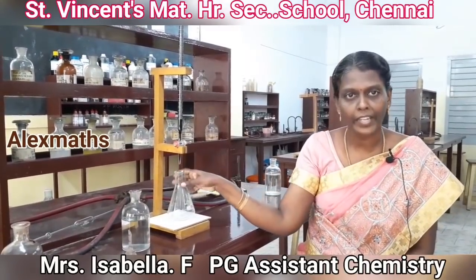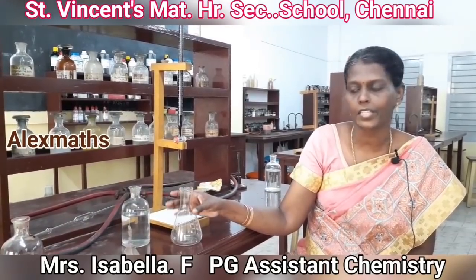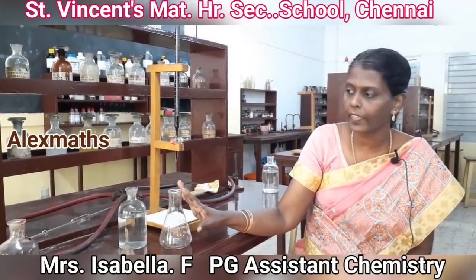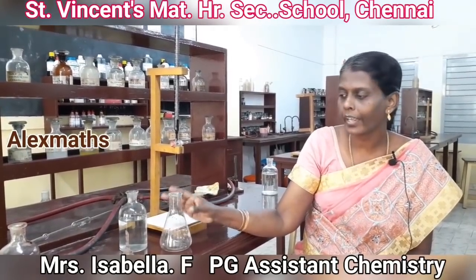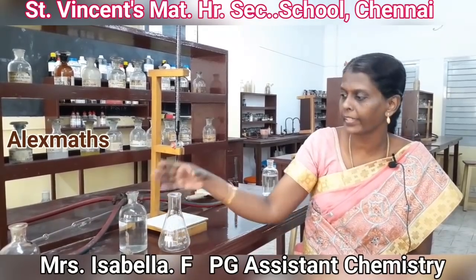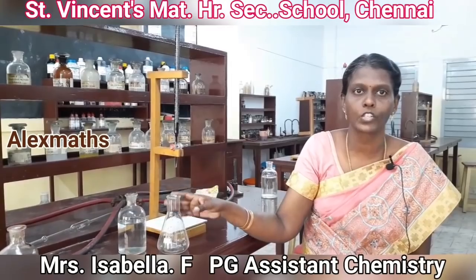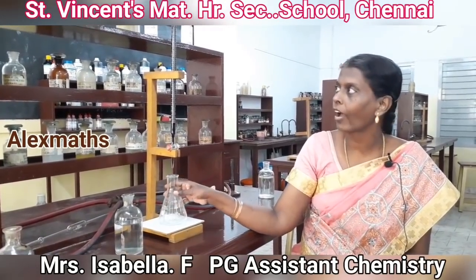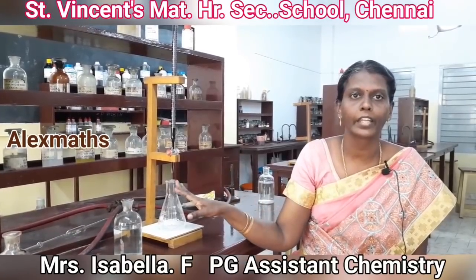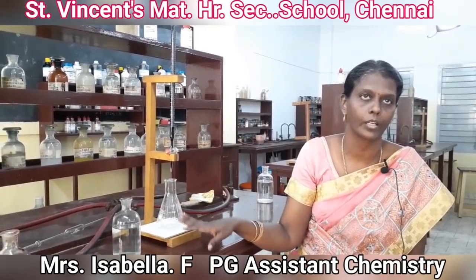Instead of taking ferrous ammonium sulphate, we take the given unknown ferrous sulphate in the conical flask. The procedure, etc., everything will be the same. Only difference will be, we will be taking ferrous sulphate in the pipette and transferring it into the conical flask. Repeat the same procedure of the titration and record the concordant value for titration 2. Enter the values of titration 1 and titration 2 in the tabular column.